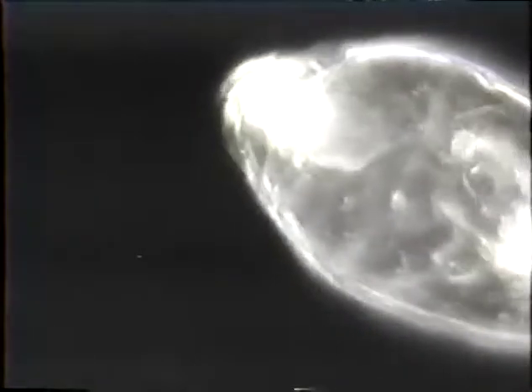This is a rotifer. Now, this organism is kind of interesting because it has a very tough outer shell around it. What happens in this particular situation is that I believe the device somehow liberates some of the enzymes within the organism's lysosomes, and it basically will self-digest. If you notice, the interior is pretty well differentiated here. In a few minutes, you'll notice that it becomes little more than a bag of mush on the inside.